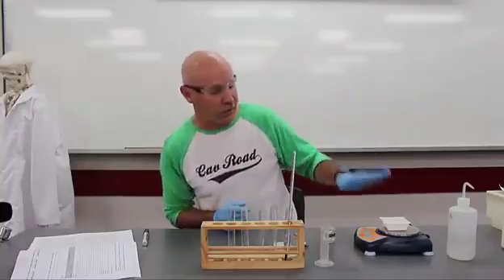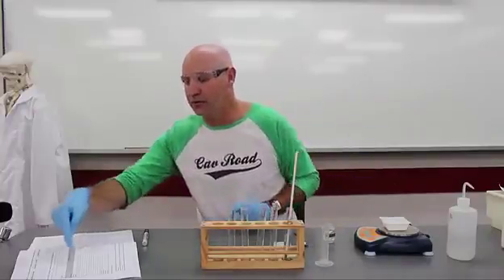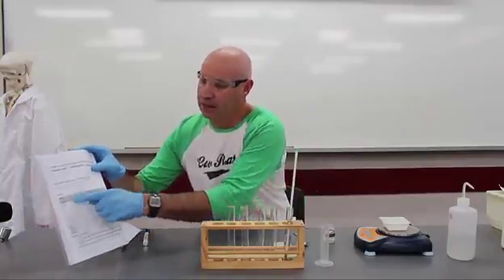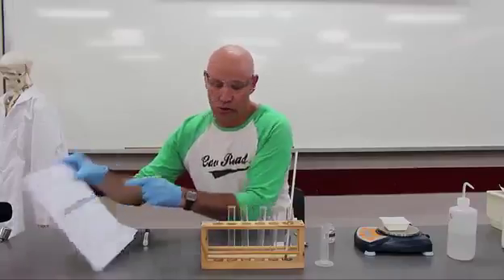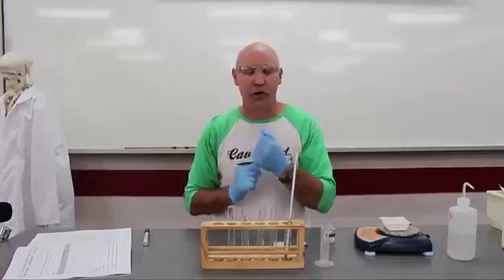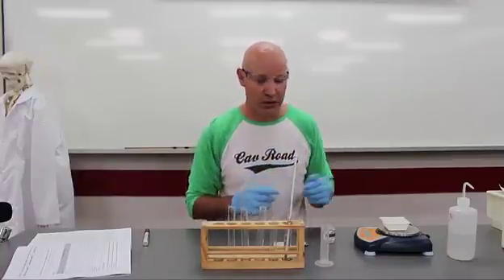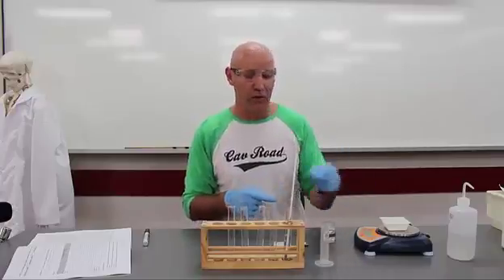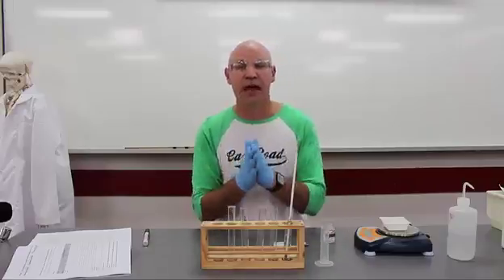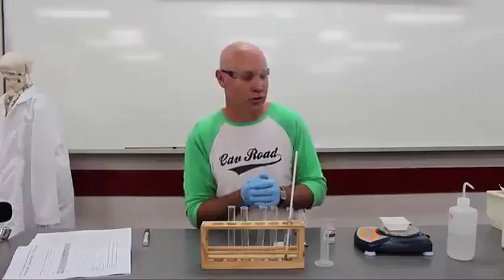Alright, so once we've done that, we're going to record our temperature and write down our starting temperature for the 5 grams, the test tube 5. Record that before you start. Have a stopwatch ready. You can use a stopwatch or your phone or your watch, because as soon as we put the ammonium nitrate in the test tube, I need you to start recording, because every 30 seconds we're going to be recording the temperature of the water again.